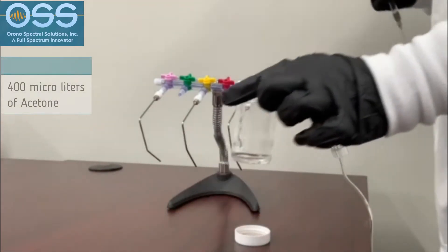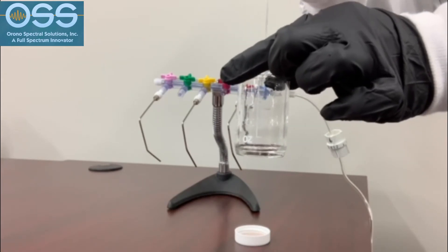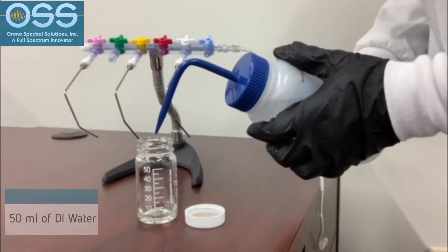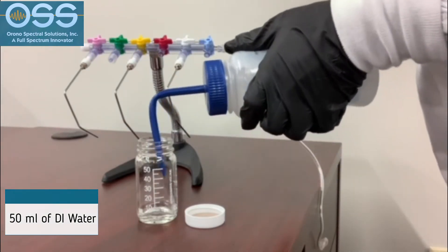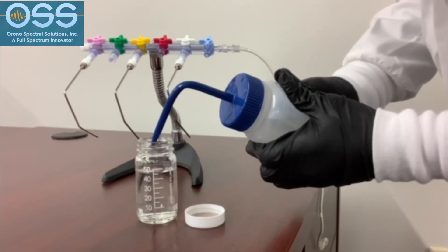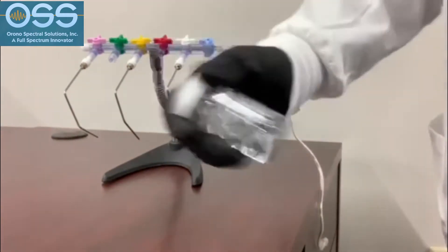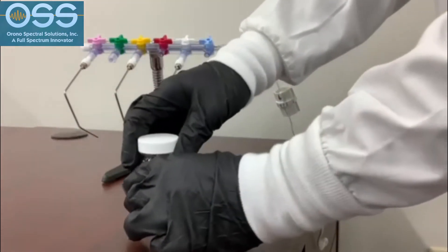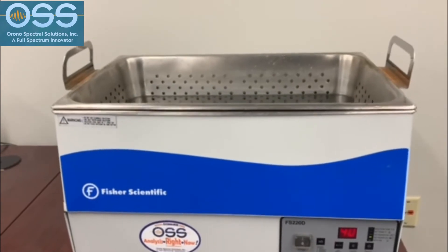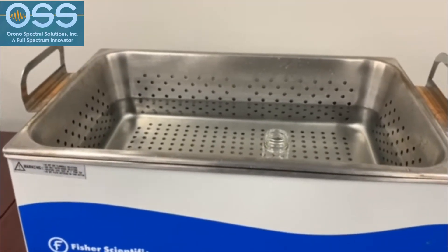Next, we are going to add 400 microliters of acetone to the jar and swirl it around. This will prepare the oil for testing in the clear shot extractor. At this time, add approximately 50 milliliters of deionized water to the jar. Attach the lid and then shake the sample, then remove the lid. Place the jar into a sonic water bath at 40 degrees Celsius for 30 minutes. The objective here is to evaporate the acetone from the sample.